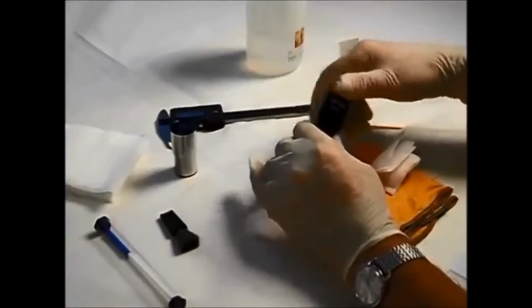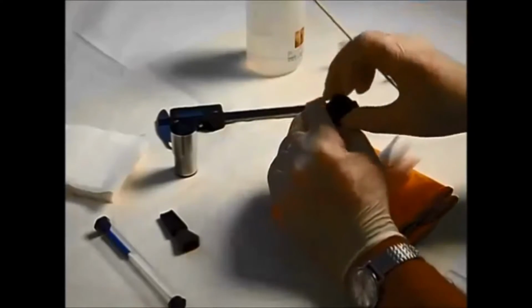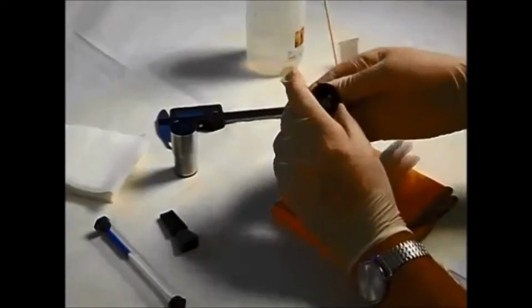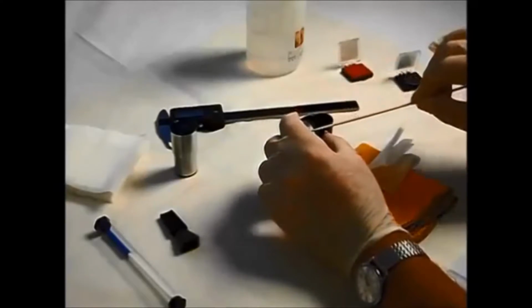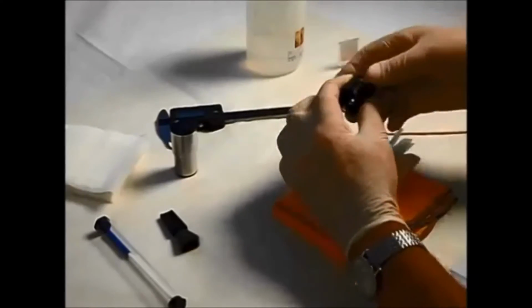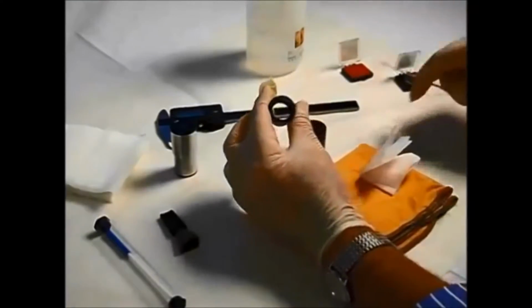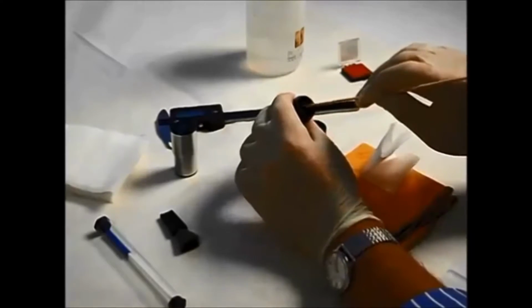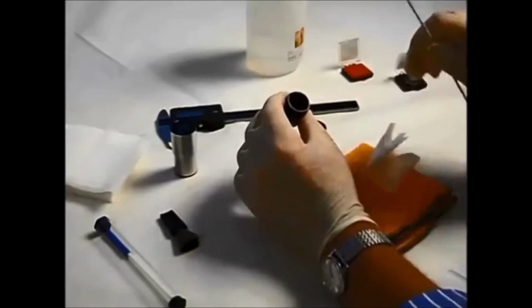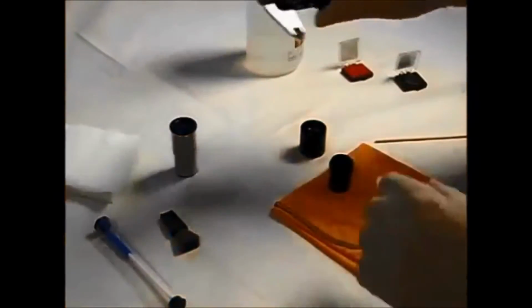Now, this is a Ramsden one, and you saw me open this one earlier. So in this case, we're looking at an open tube here, and the lenses are in this piece here. You can see the lenses here. So this is the eyepiece lens, and there is the field lens about here, and the reticle is actually held in this open tube. Now it's a little bit like the diagram you saw earlier. As you can see, there is a shelf here which holds the reticle itself, and that is what we need to measure now to get the dimension for the reticle to fit this one.